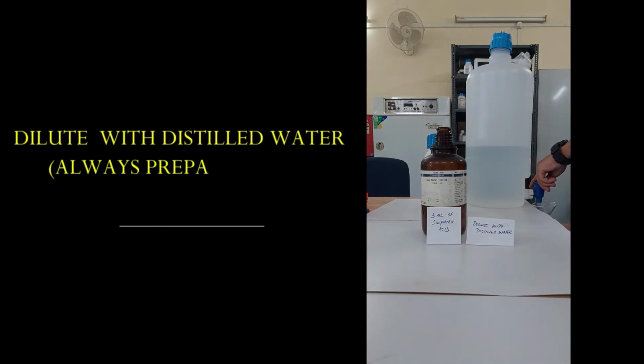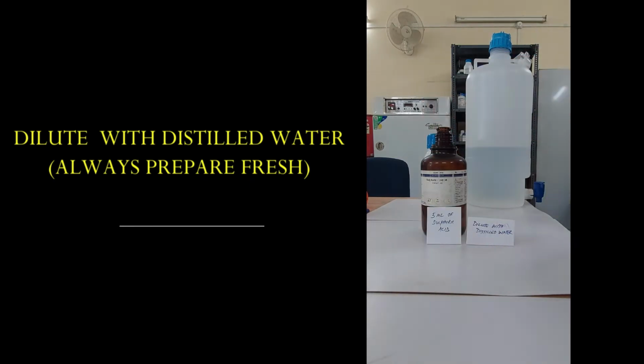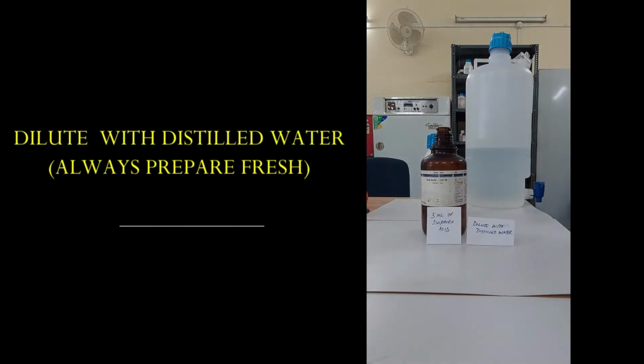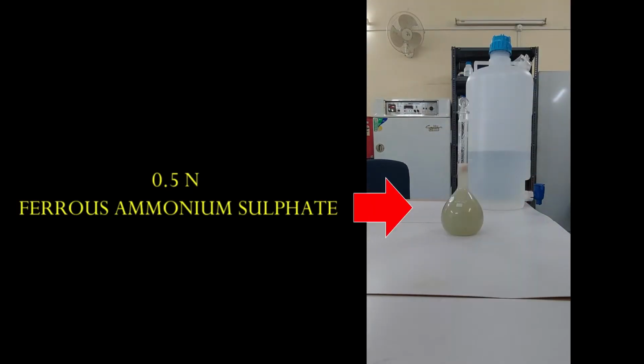Now, once this is done, then dilute this with distilled water, and always prepare fresh ferrous ammonium sulfate for any analysis. Now, this is a 0.5 normal ferrous ammonium sulfate.